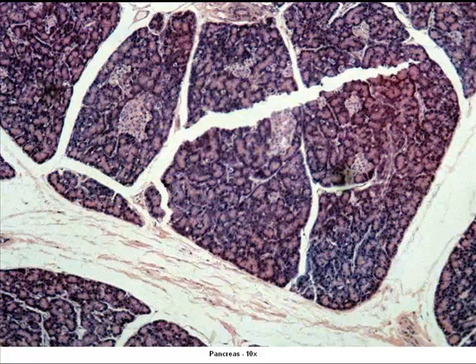So for the endocrine section, instead of just the one slide that's listed in the lab manual, we'll actually have 4 slides of different endocrine organs. This one here is the pancreas. It shows it at the low power magnification. We've seen this slide before when we viewed it for digestive system.